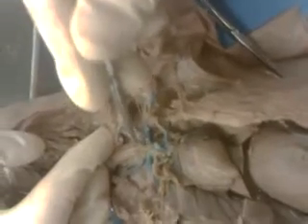so there's the common carotid artery, the internal jugular vein, the external jugular vein, and the subclavian vein, and all those come together and form just right here, they just join up. That would be the left brachiocephalic vein, and the right and left brachiocephalic veins join to form the superior vena cava right there.